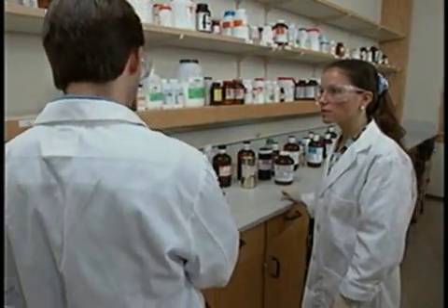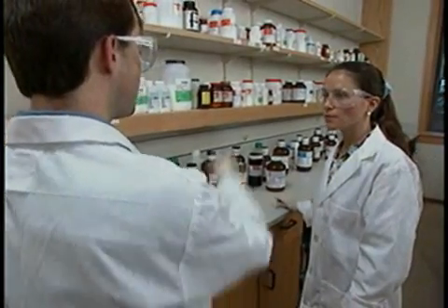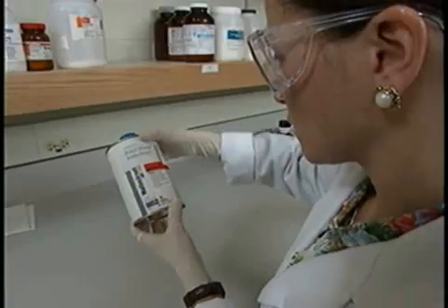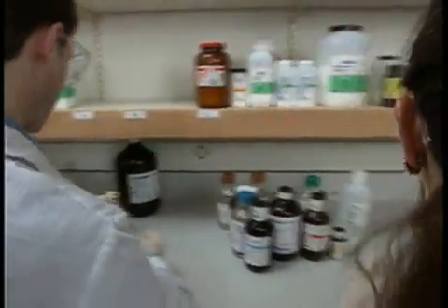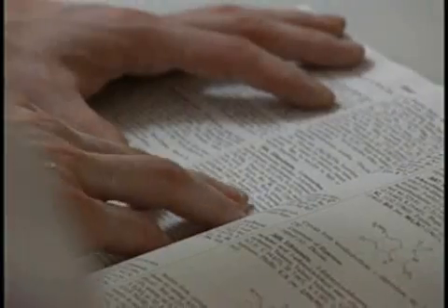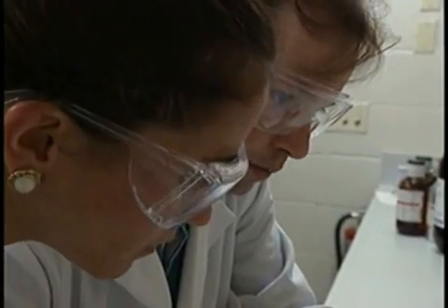They sort the chemicals into acids and bases, flammables, and some that need to be looked up later. The idea is to determine major storage groups that are practical and consistent with the policies of your institute. Mario and Lisa know it doesn't pay to guess — any chemical they're not sure about, they look up. The MSDS or other authoritative reference can provide guidance for proper storage.